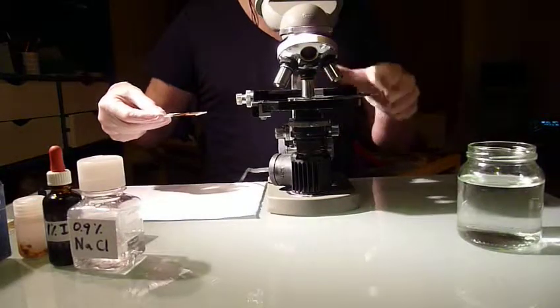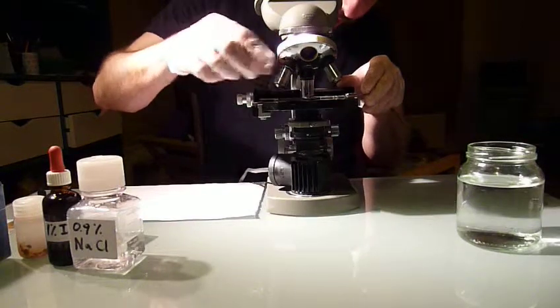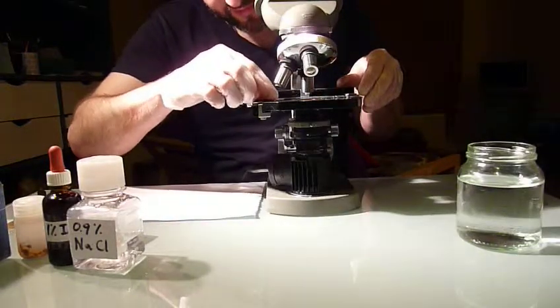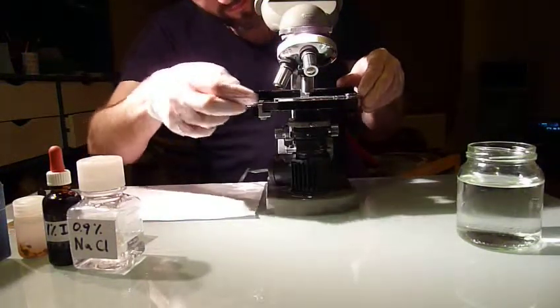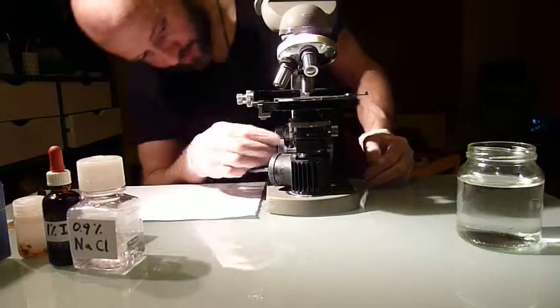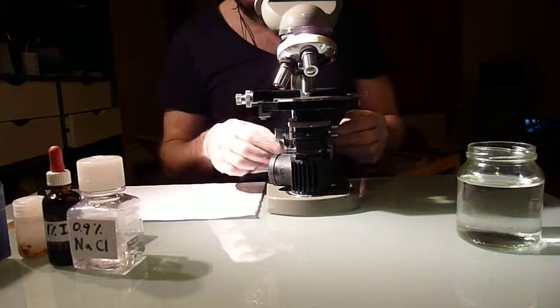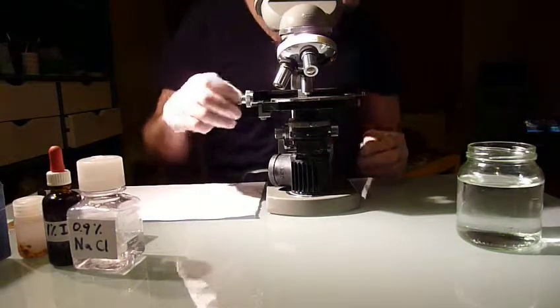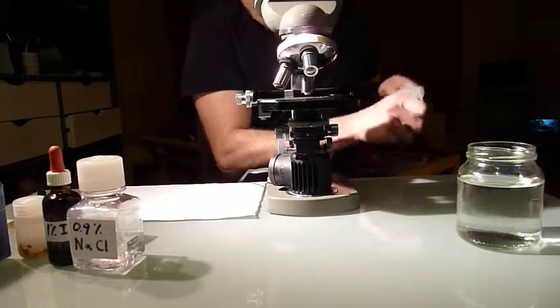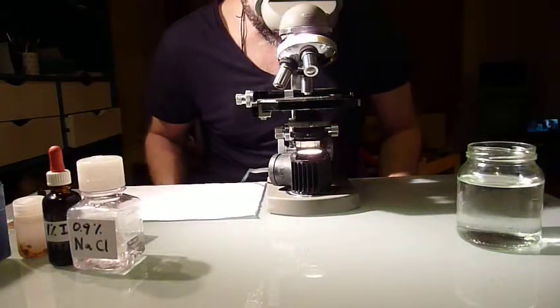So then you take your microscope and you put the sample under there, under the 10 times lens. You move first to the thick sample, so the one with the most material in it. This is actually the point to take off your gloves, because otherwise you may contaminate your microscope. And then you just have a look.